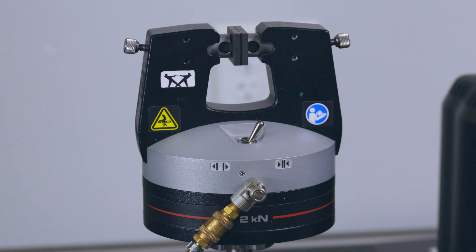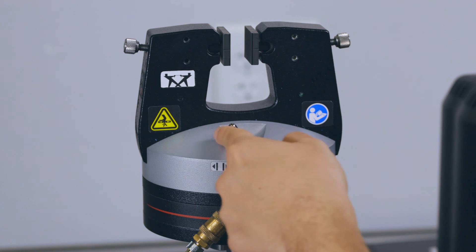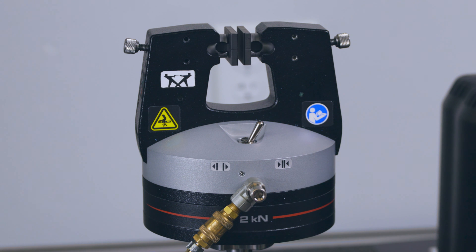These grips have an adjustable airflow control allowing you to change the speed at which the jaw faces close on the specimen. You should adjust this screw until you find a closing speed that you are comfortable with.